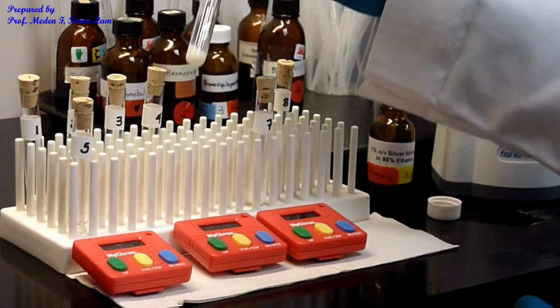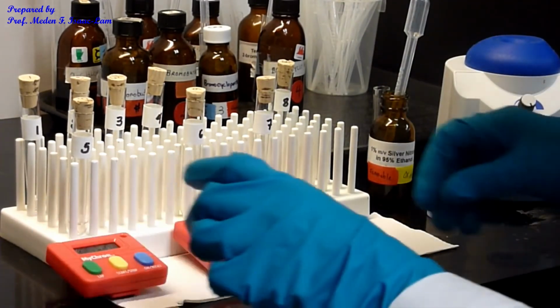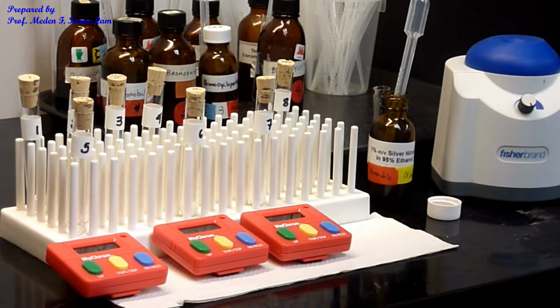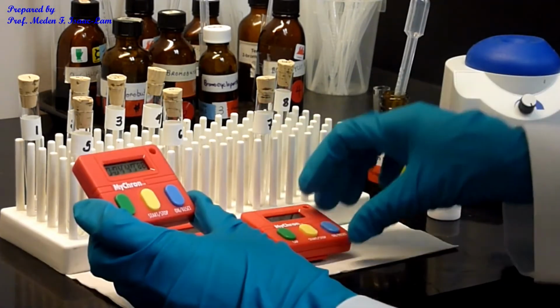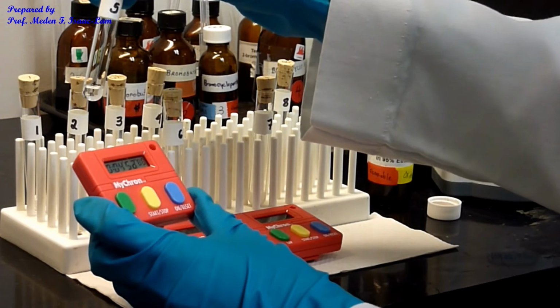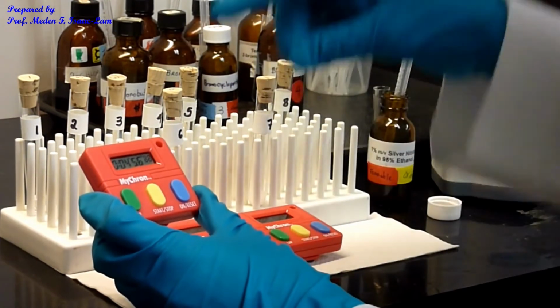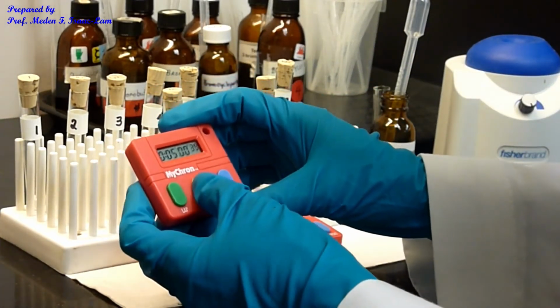Okay, so 6. And then the last one is going to be number 8. And then we'll just finish this. So nothing, did not react. Okay, I don't see any white precipitation. And number 5. So we're going to heat up 1 and 5 later on. Okay, so done, 5 minutes.